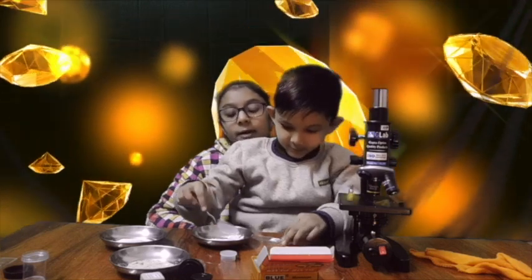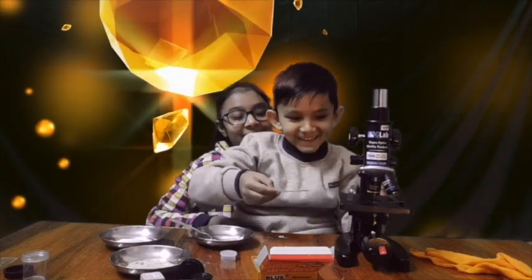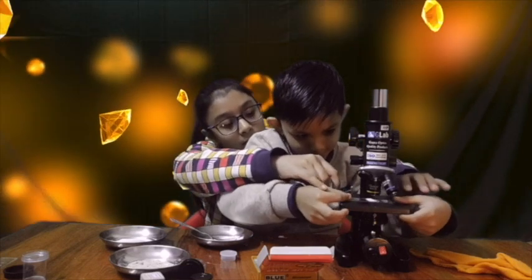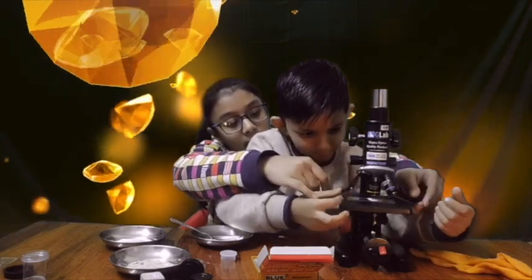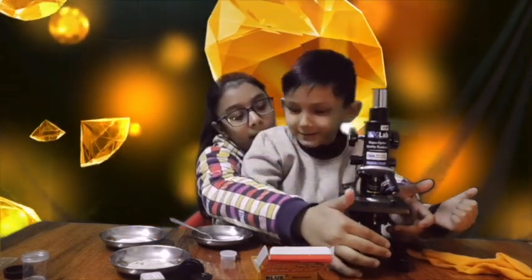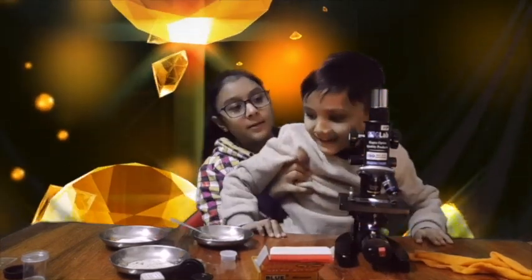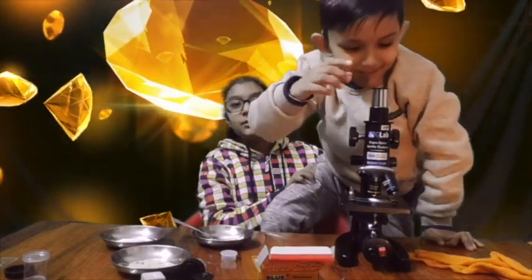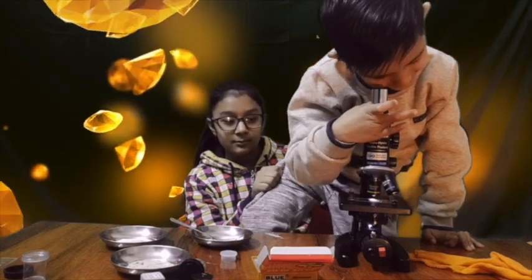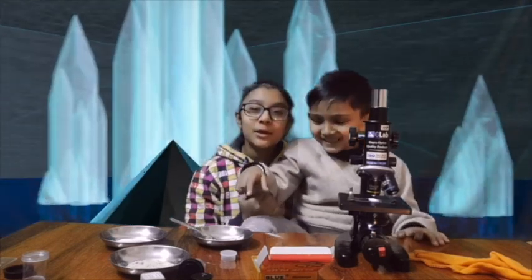Okay, now put it under already. I want it to be perfect. It's okay, wait wait, now put it. When will you make a scientist? And like that, now see it. Wow, how should I stand? I have absolutely no idea how he fits in. Why does this look like chili? It looks like chili.